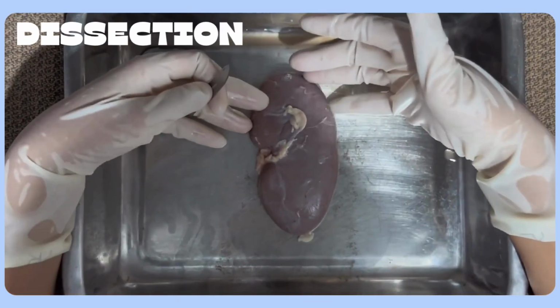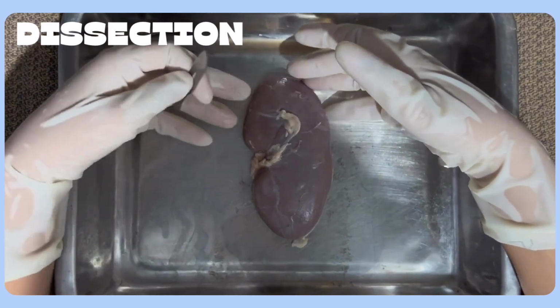After identifying the external parts and their functions, we are now going to dissect our kidney.